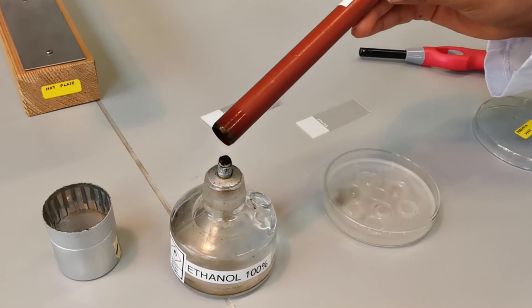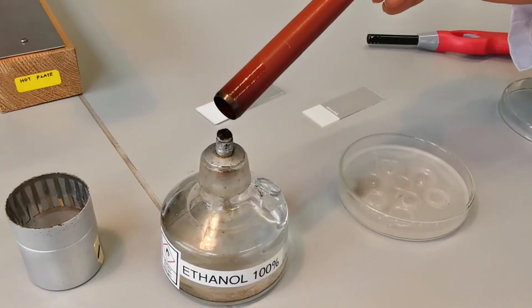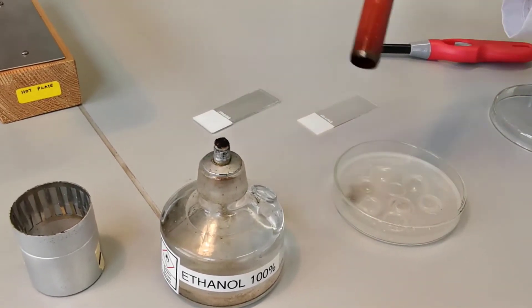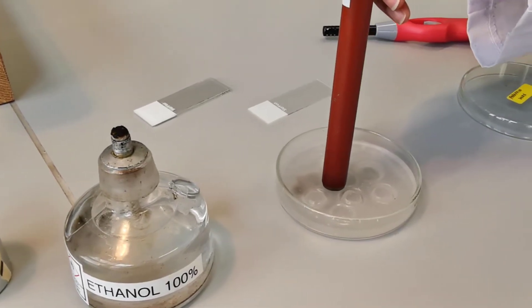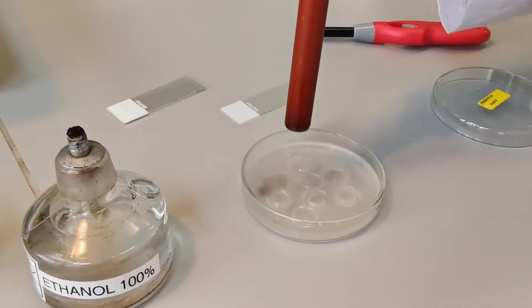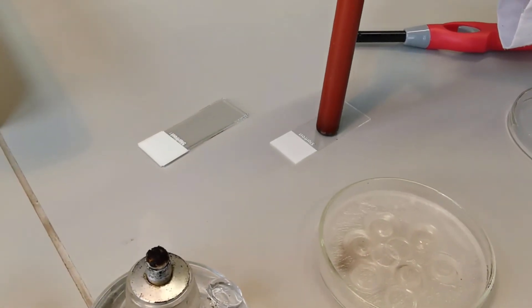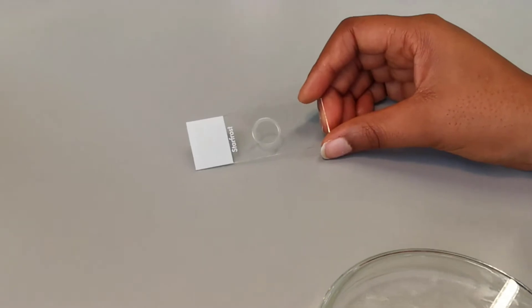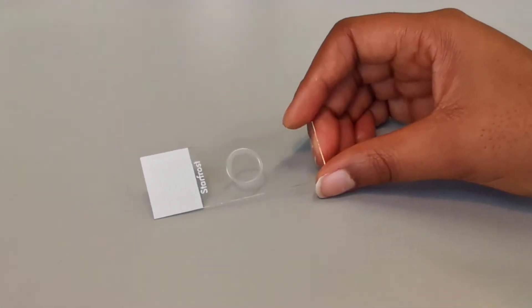Here, be careful not to overheat the rod to avoid formation of a thick ring of wax on the slide. The ring of wax on the glass slide should look something like this.